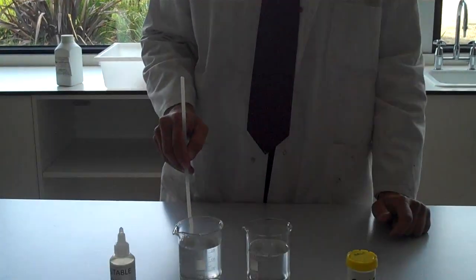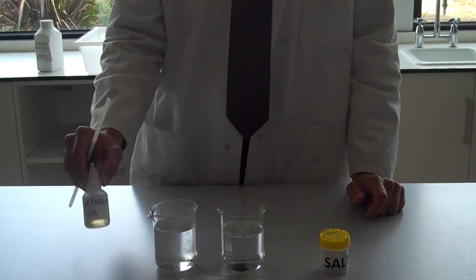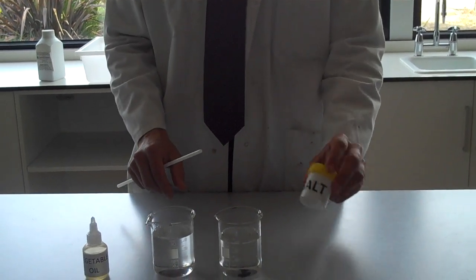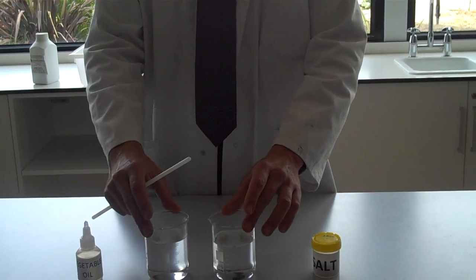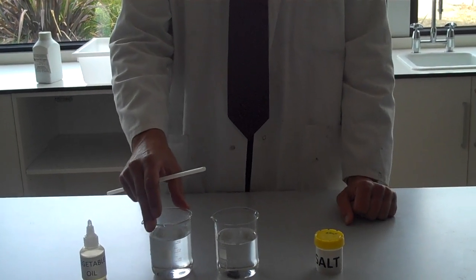Alright, so this PoE is to test the solubility of two different substances. We have vegetable oil and we have salt. And I've filled up two beakers with warm water, approximately 200 milliliters each.